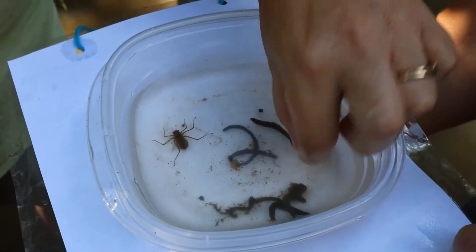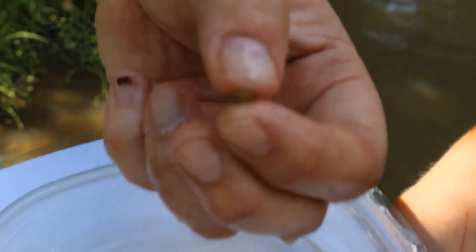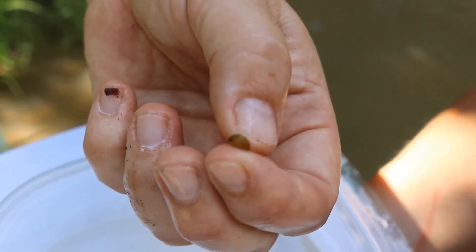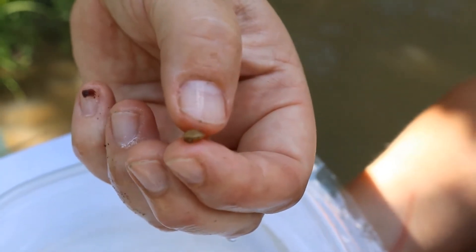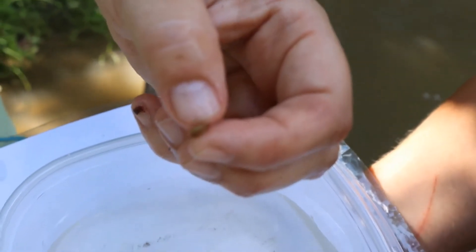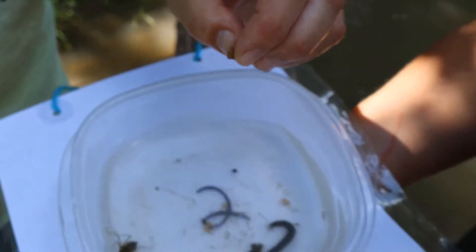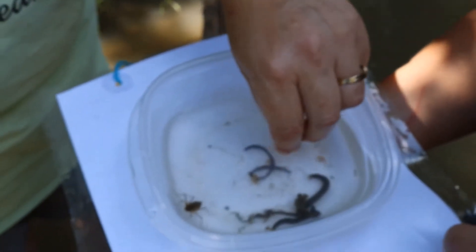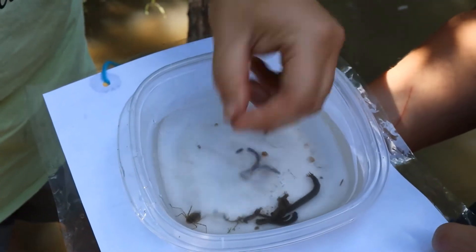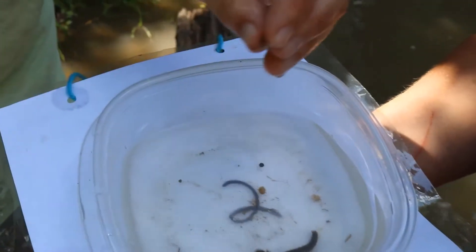We have clams. To count a clam, you have to make sure it's actually alive. These are tiny little fingernail clams — you can tell the shell is shut. If I tried to force it open, I probably couldn't, or I would break it and kill the clam. So that clam is counted because he is alive. There is a clamshell in here that's just half of it — we can't count that because it's not living.